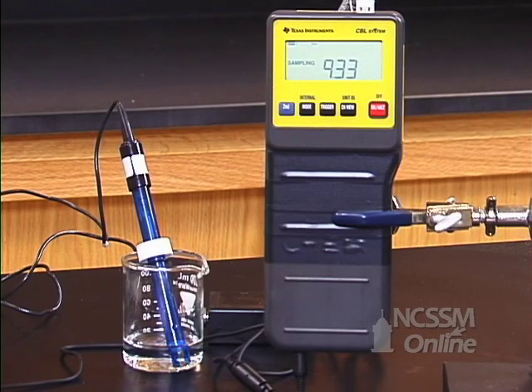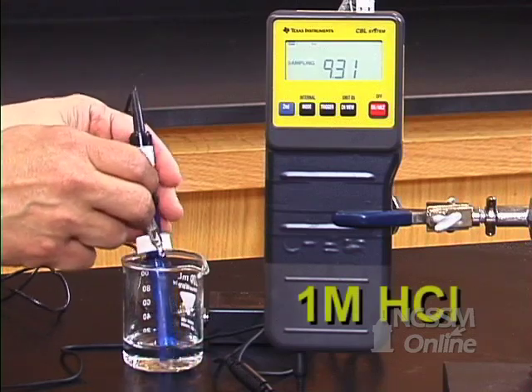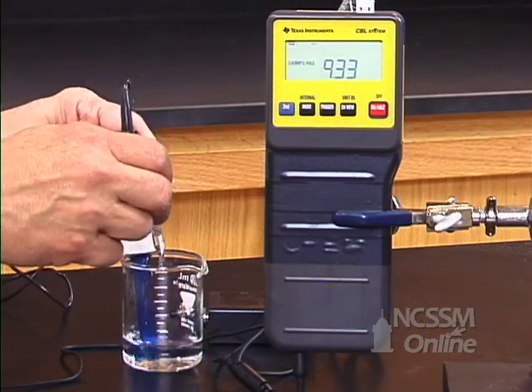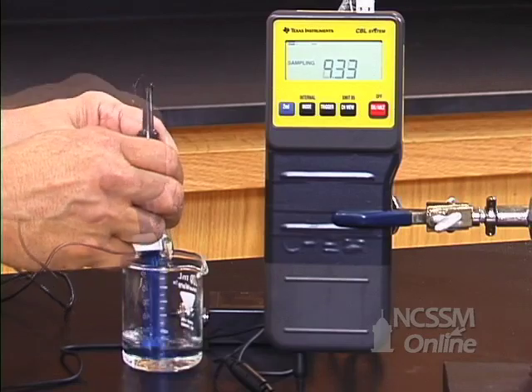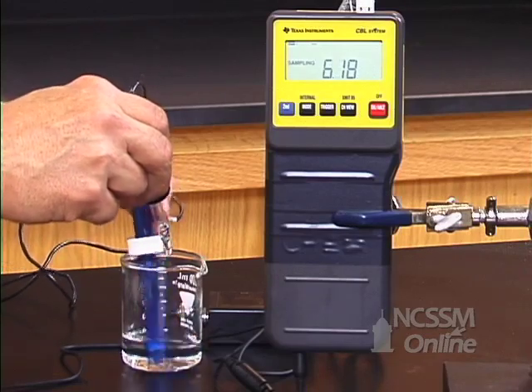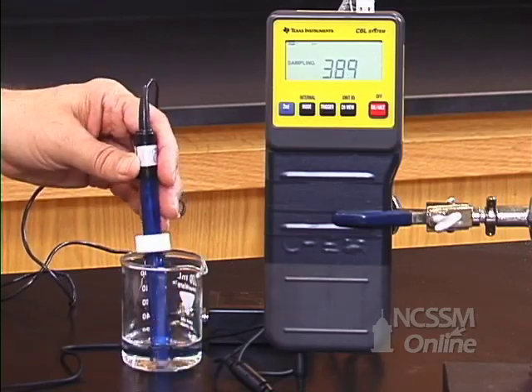If I add some HCl to the buffer, the pH has not changed very much. After adding 15 drops, the pH has dropped rapidly.